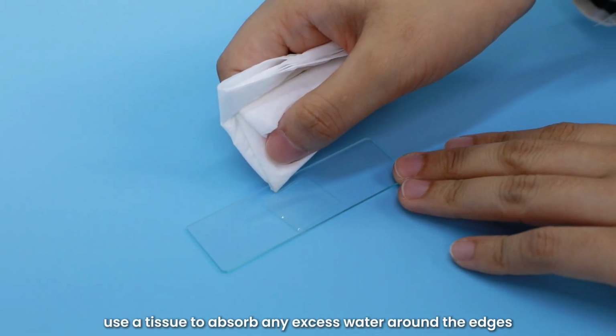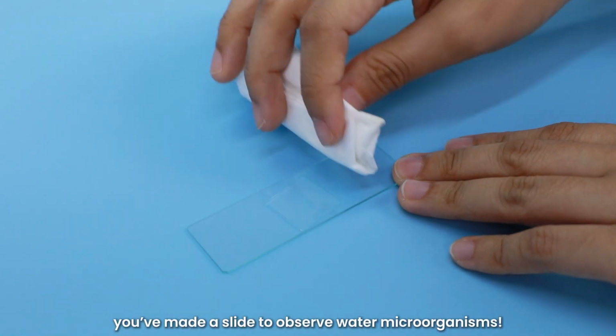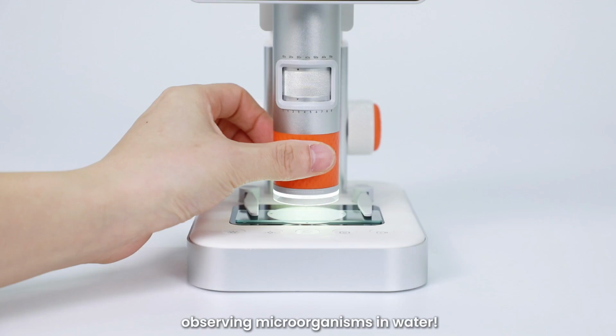Finally, use a tissue to absorb any excess water around the edges. And just like that, you've made a slide to observe water microorganisms. Now, please follow these steps to make your own slide for observing microorganisms in water.